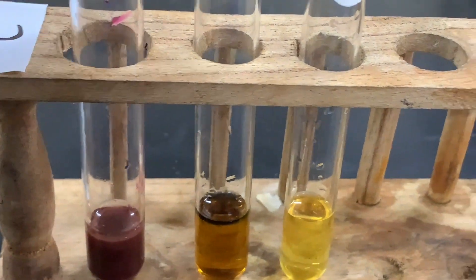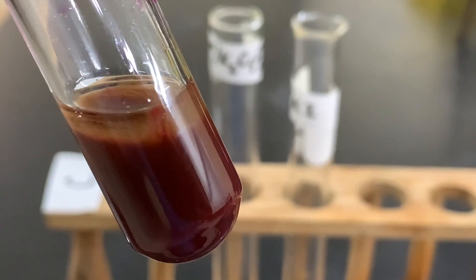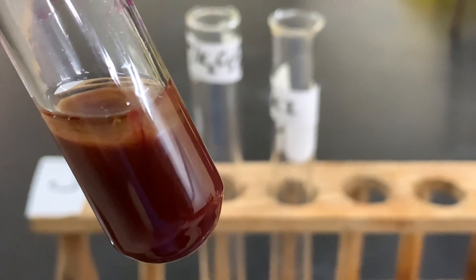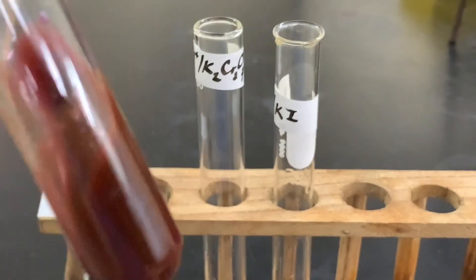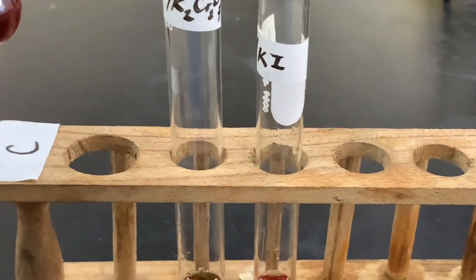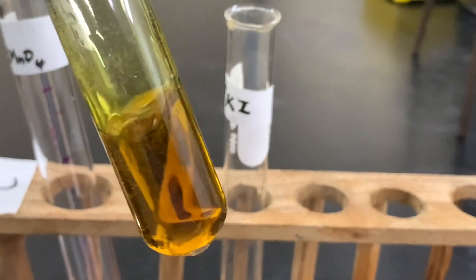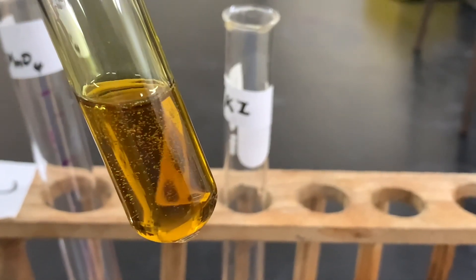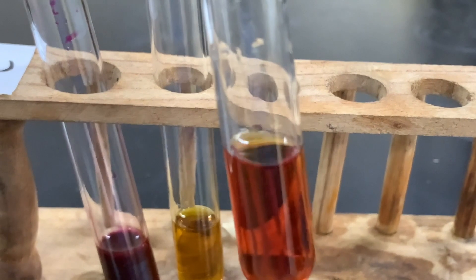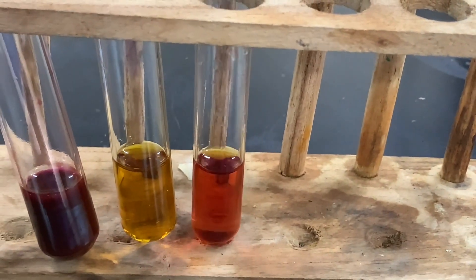Close up — look closely. There's a phenomenon occurring. Some will say bubbling; however, the correct term is effervescence. Just agitate it a little bit. We'll let it sit so the reaction can complete. We'll observe this one closely, agitate it a little, and we're seeing some effervescence as well. We'll let it sit, and I want to make a note of any color change, any effervescence, anything that is happening.